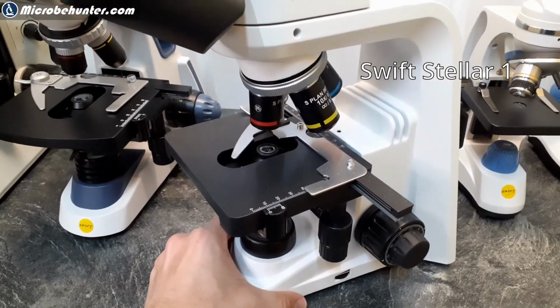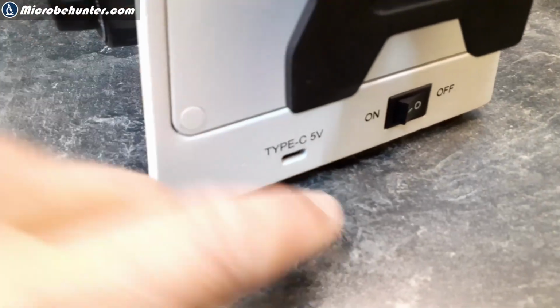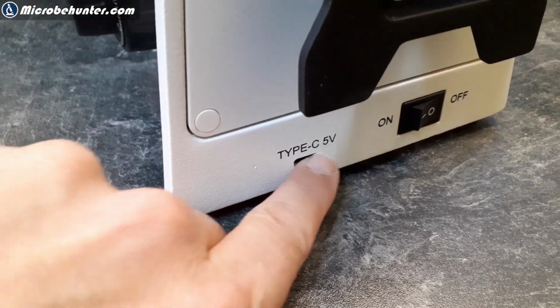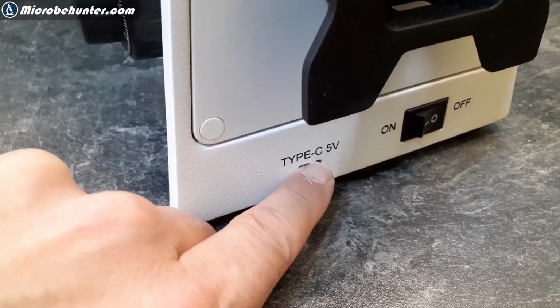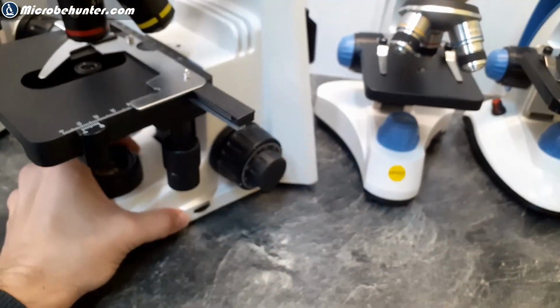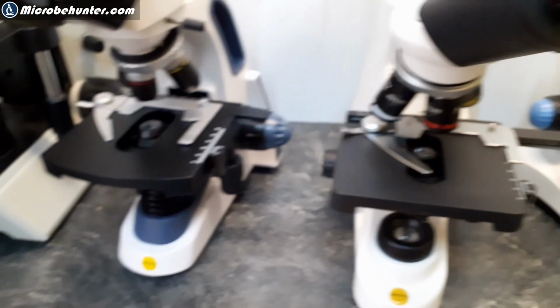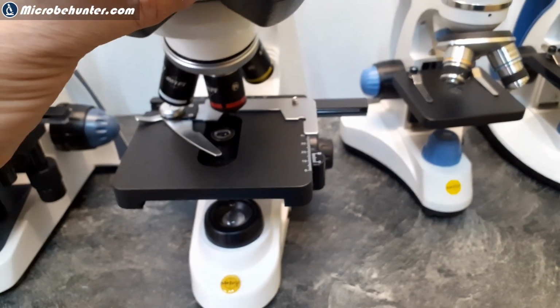same concept. This one is quite interesting because it has quite an interesting power supply. If you go all the way down here, you're able to see that it has a USB. You can put in a USB and also connect it over to a battery here, or an external power adapter. So basically, I try to make the following very clear to you, that the basic features of the microscopes here are pretty much the same.